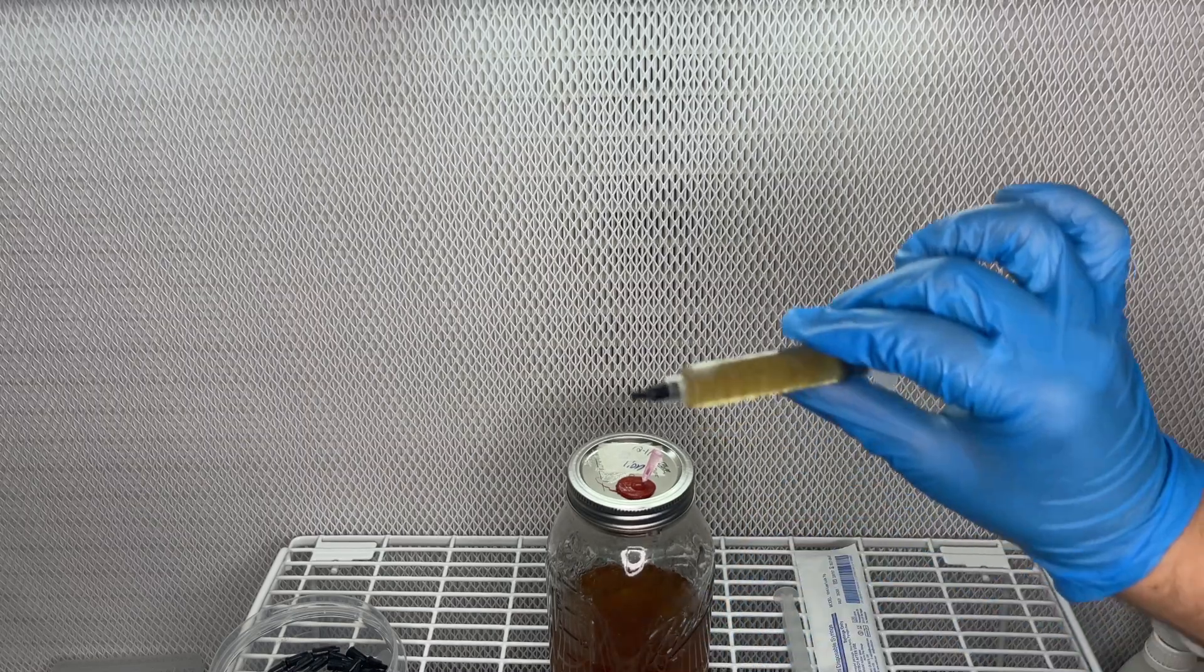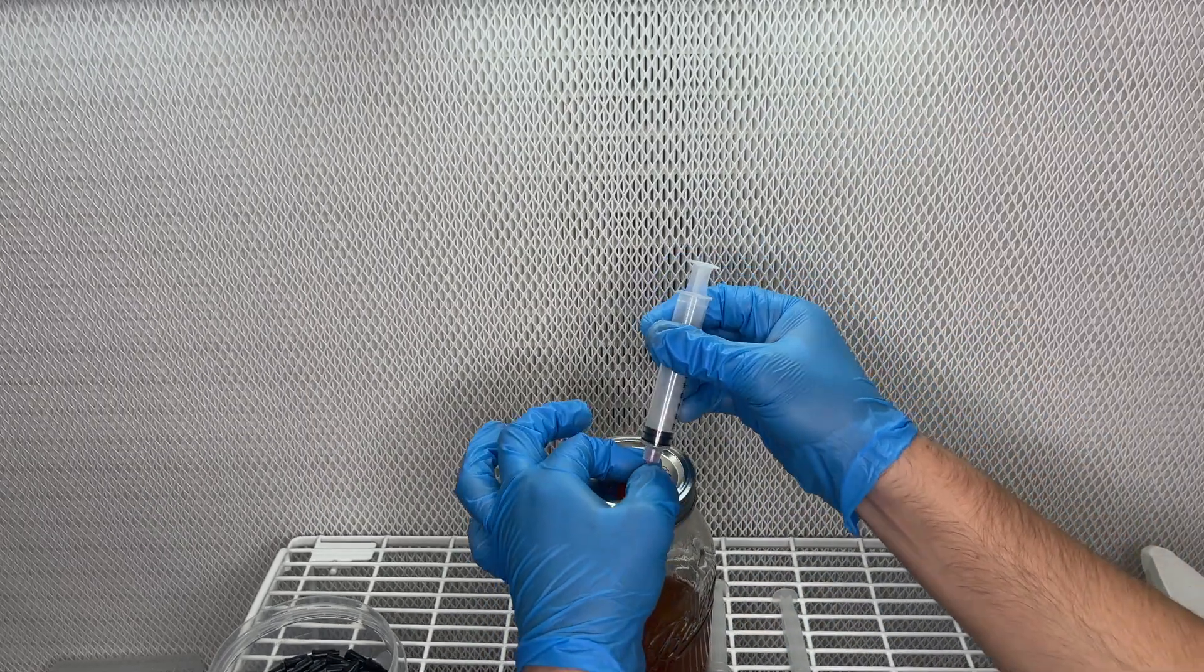Just make sure to wear a mask, wipe everything down with isopropyl alcohol, and wear some gloves.